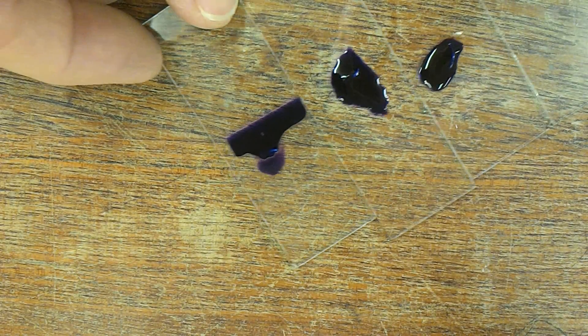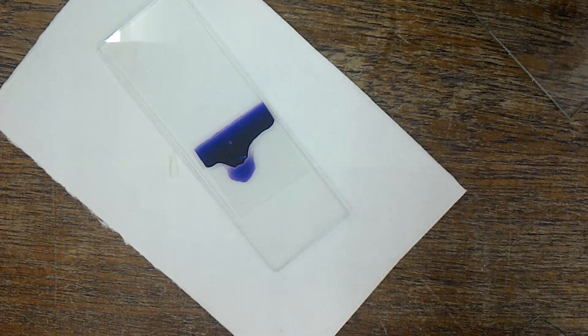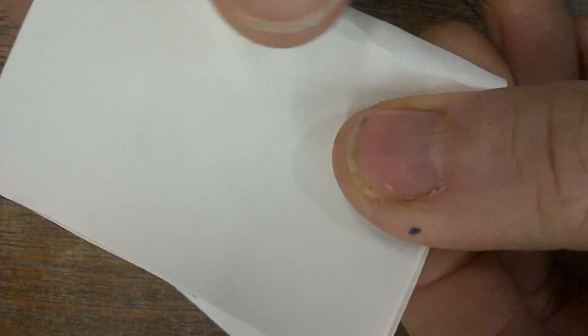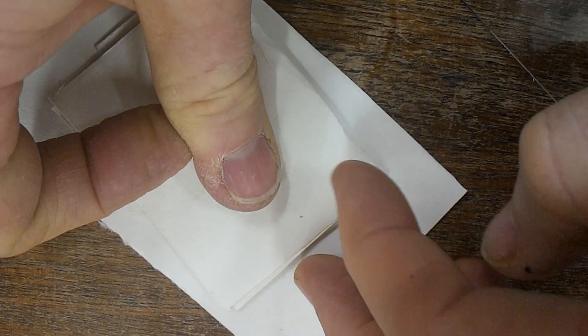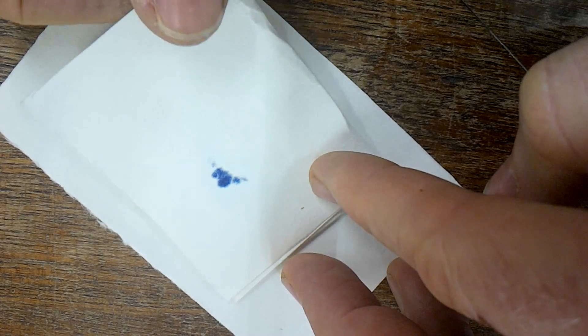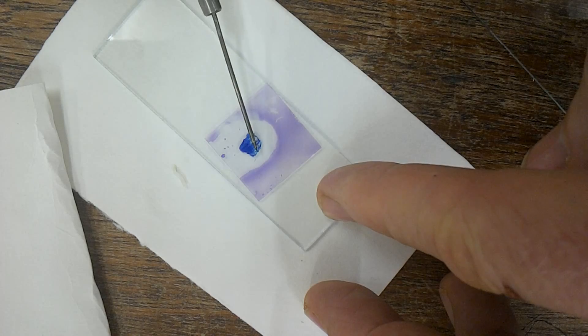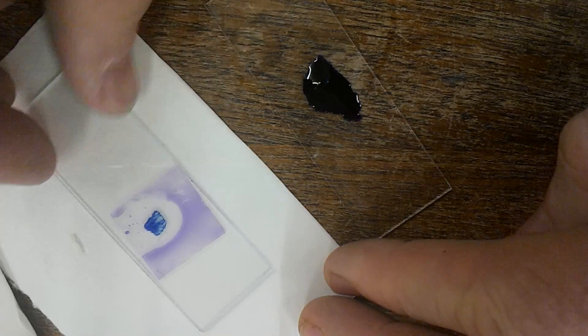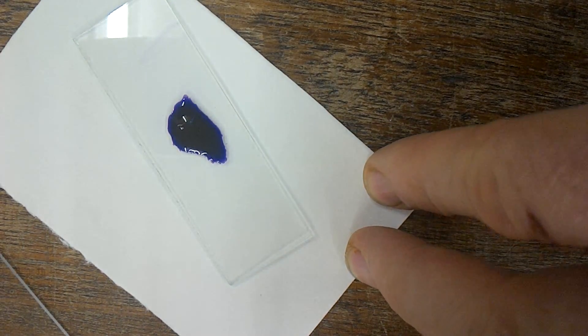Take another piece of filter paper. I suggest that you fold it in half, bottom paper over the top. Then press harder than you think should be possible—press down firmly. You should see the cells have spread nicely, hopefully into a nice single layer. You can repeat this process for the rest of your cells.